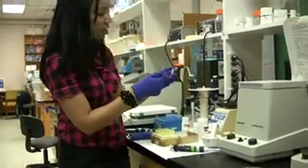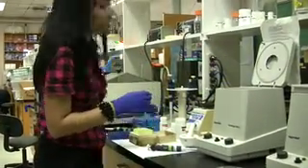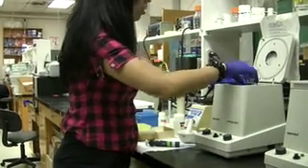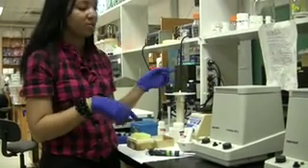It's incubated for five minutes. We're going to go ahead and resuspend the DNA by placing it in the centrifuge for one minute at 8,000 RPM. Then we're going to repeat the whole washing process again, but with 50 microliters of the preheated buffer.